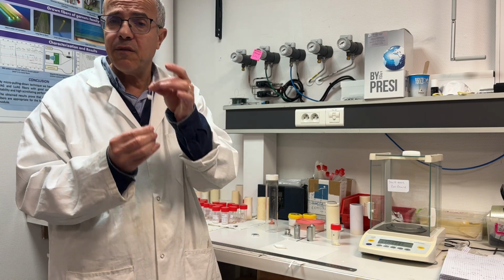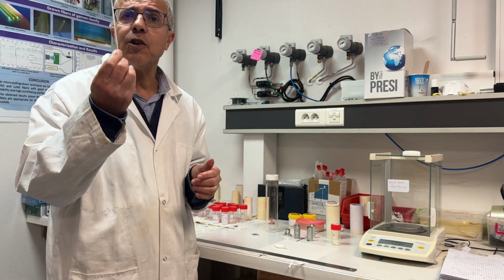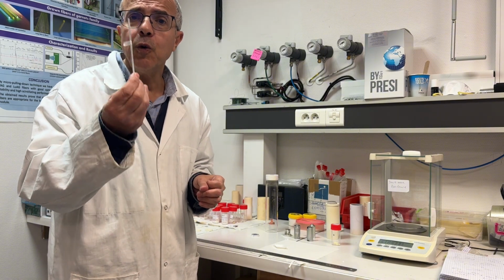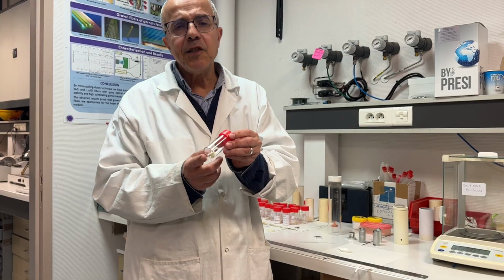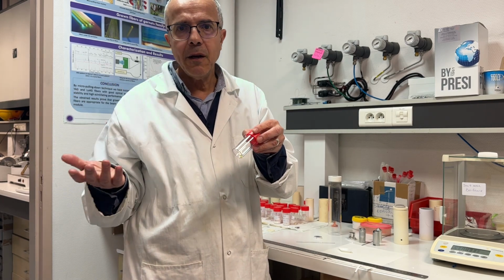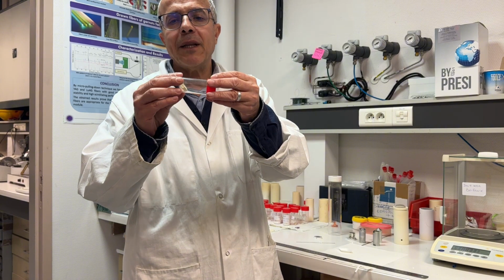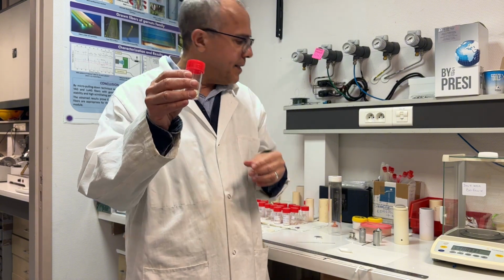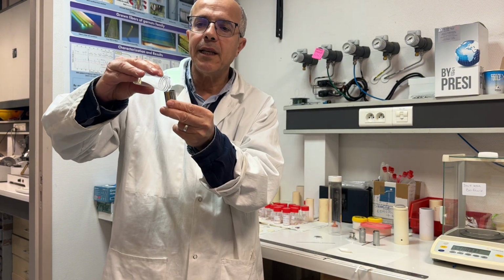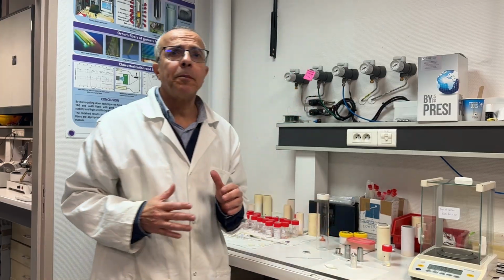And the seed is very, very important because it fixes the orientation of the crystal that we would like to grow. That is the raw material. As you know, to grow crystal, we need material with a specific composition. So that is an example of the raw material that we use. And this material, we put inside the crucible. And after that, let's start the preparation.